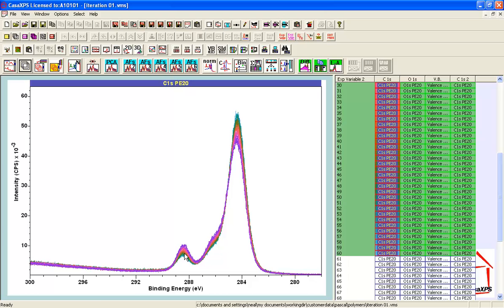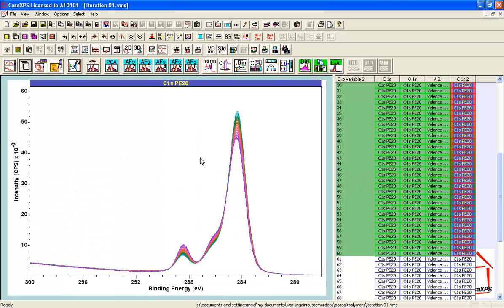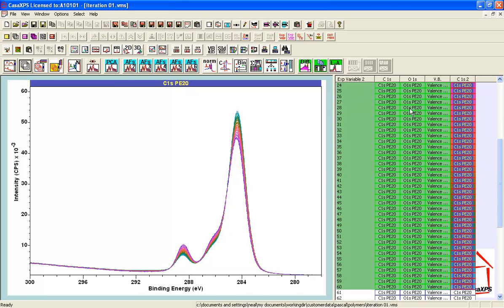that the amount of double bonded carbon, oxygen is very much reduced. Similarly, this single bond very much reduced, and we've got a range of different intensities somewhere in between the CC and the CH and whatever else has appeared in these data that is unrelated to PMMA. So these are the raw data. I'm using the arrow key and I'm going to step across. So we see in the oxygen 1s there's definitely changes in the oxygen. The valence band, not so obvious, but I've now got the PCA enhanced data for the carbon 1s, and these are in the range 20 to 60 as far as the indices for these individual measurements.